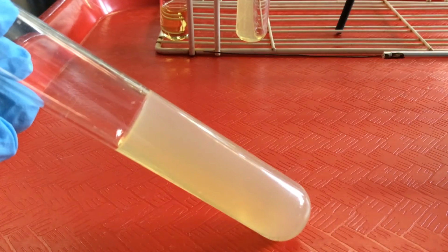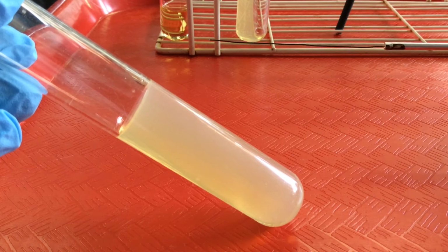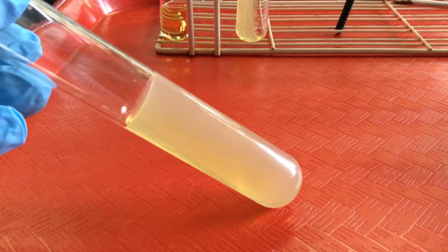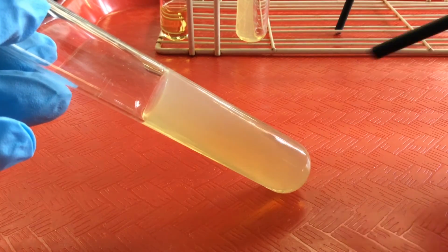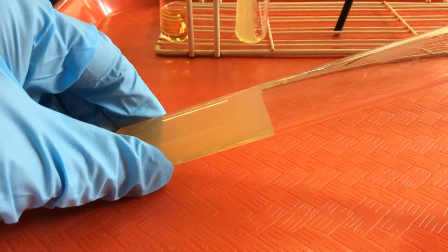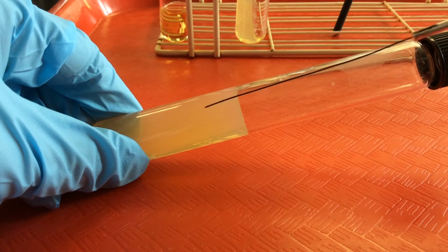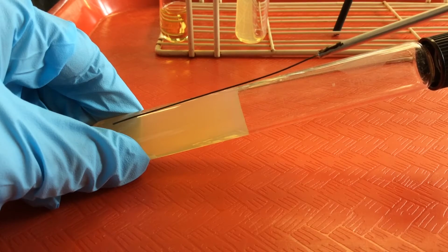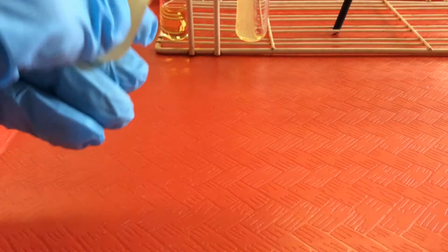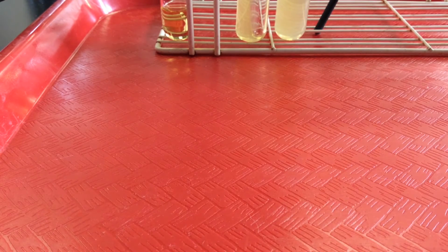You'll recall we discussed our agar deep. And let's say that we wanted to transfer some bacteria into the very bottom of our agar deep, right down here. So the way we would do that is that we would use our inoculating needle, and using sterile techniques, which we'll demonstrate to you, we'd actually stab the microbes right through that agar deep down to the very bottom, and then we would withdraw. And we'll have a lab on how to do aseptic transfers. I'll discuss it in greater detail.